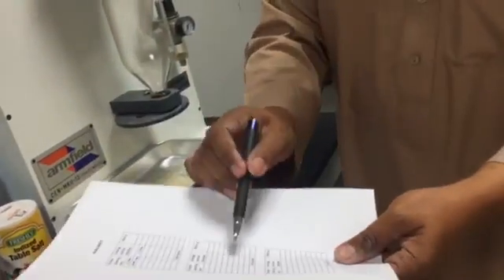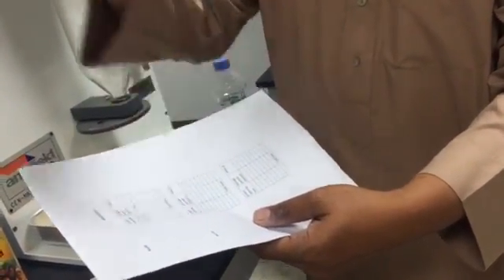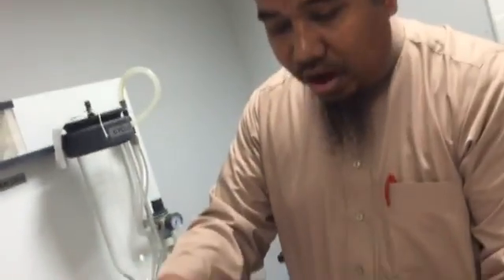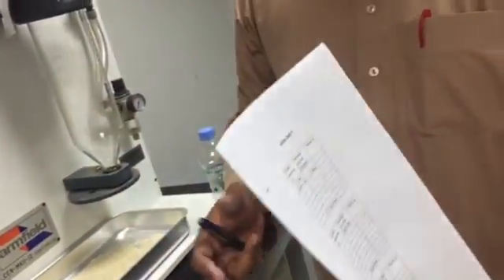From each size, let's say you decide the smallest one, and then the bigger after that, and the bigger one after that. From these 3 experiments, you combine the sample. So you will have 3 different sizes. Okay.